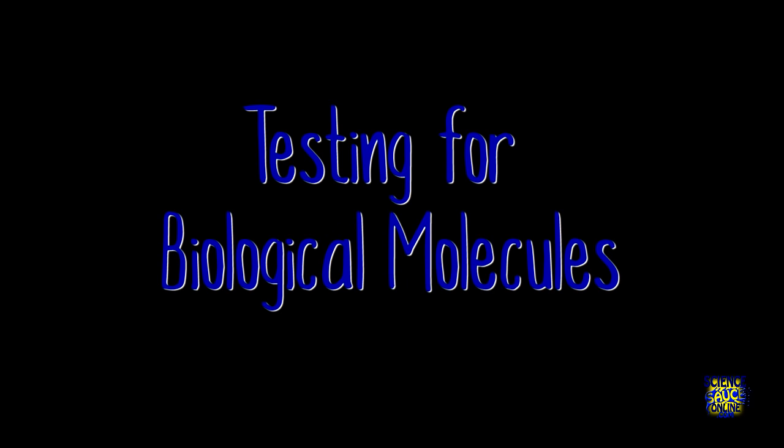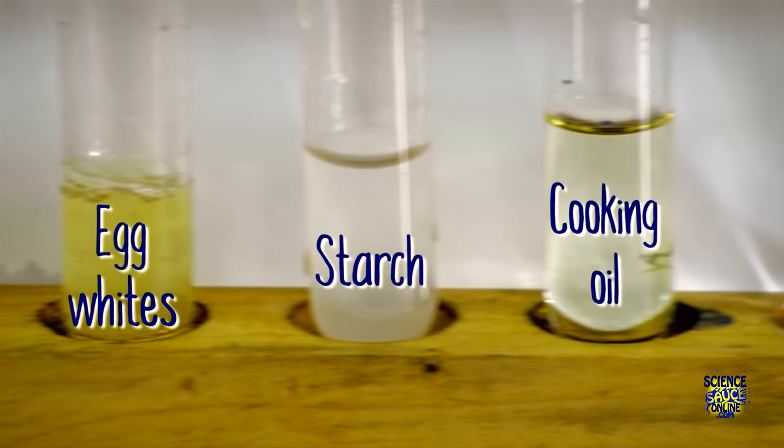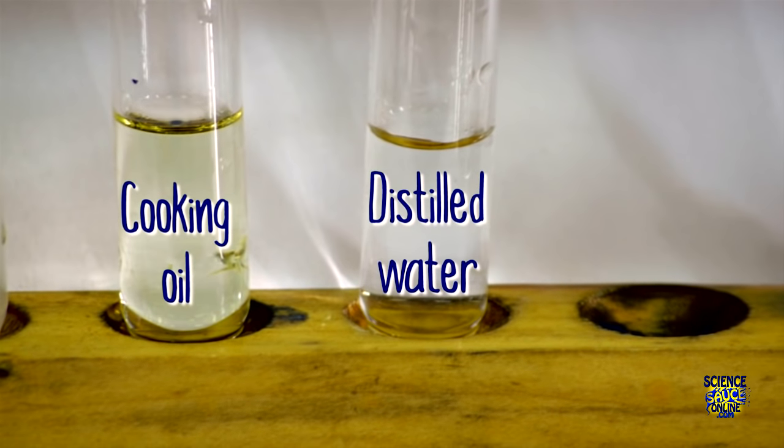In this video we're going to be looking at the tests we do for different biological molecules, sometimes just known as food tests. We're going to be investigating fruit juice, egg whites, starch, regular cooking oil, and we're also going to use distilled water as a control.